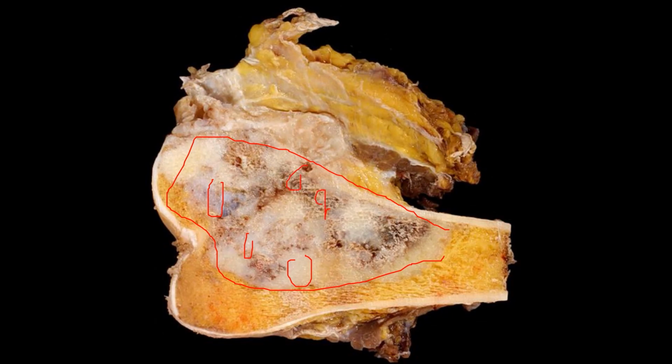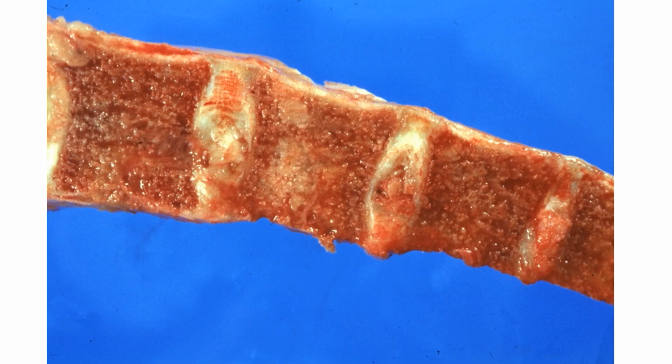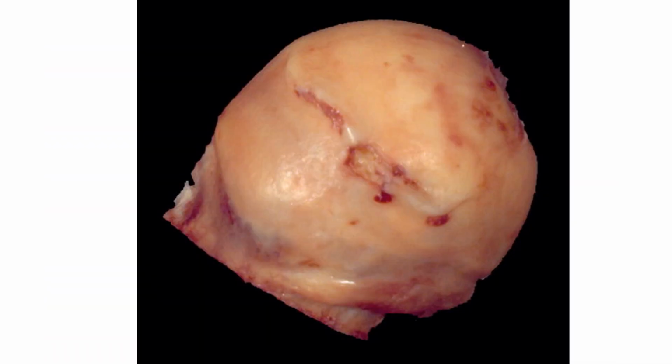All right, okay. Next is metastatic carcinoma. This is the vertebra. So in this vertebra, you can see there are multiple small lesions. These multiple lesions are basically metastatic lesions that originate from other organs, right? And because this is also still a malignancy, it has a heterogeneous cut surface with areas of hemorrhage and necrosis.